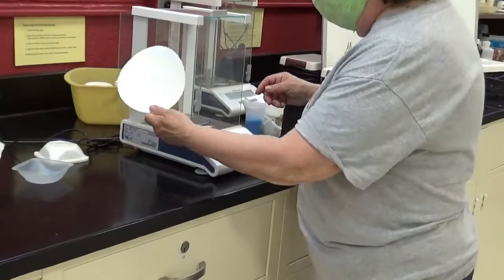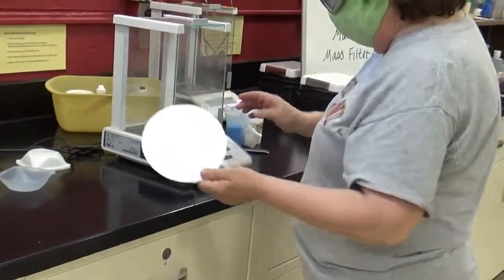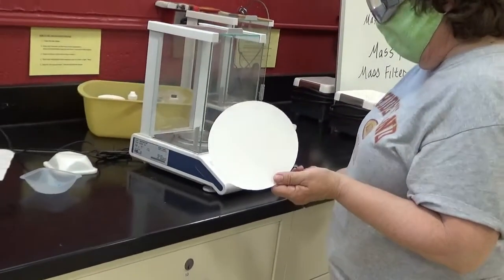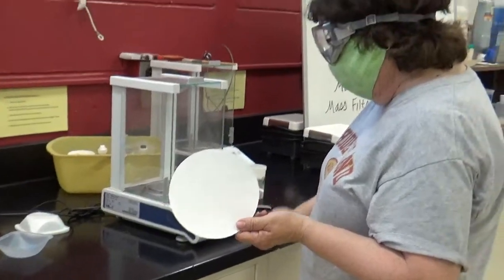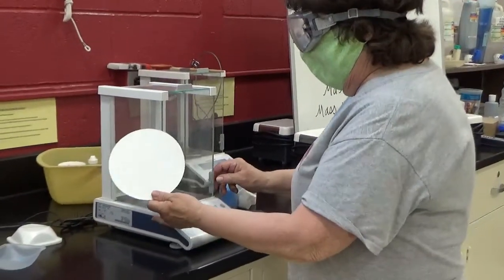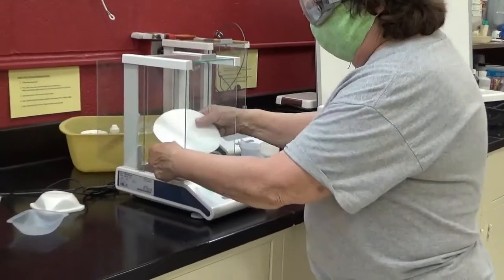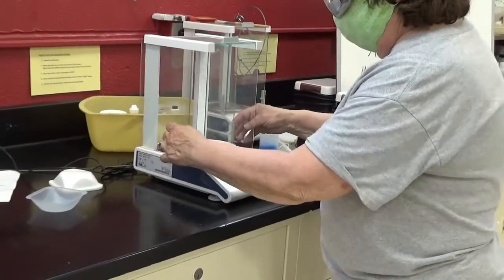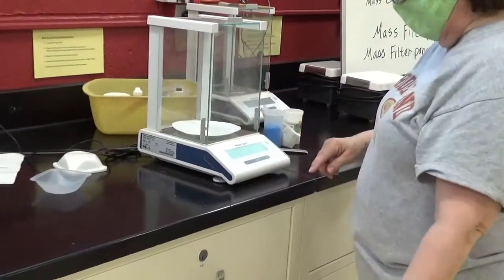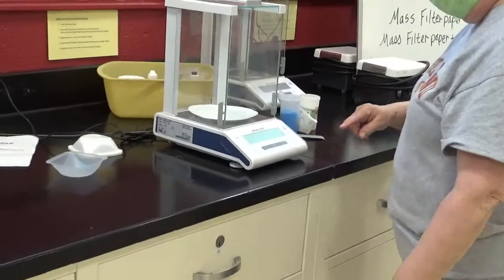So what I'm going to do is open this up, first I'm going to zero it out, and I'm going to put my filter paper on it, and notice it doesn't touch anything, and the filter paper is a mass of 1.494.